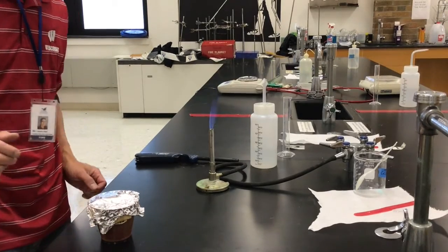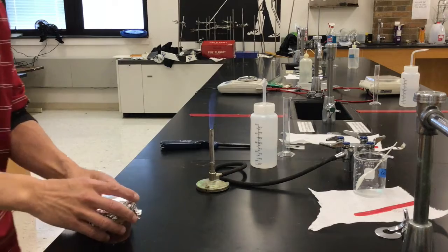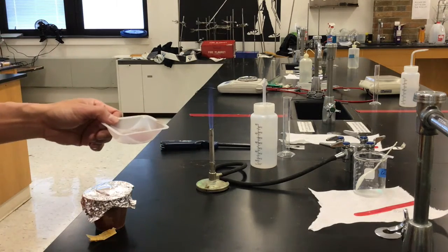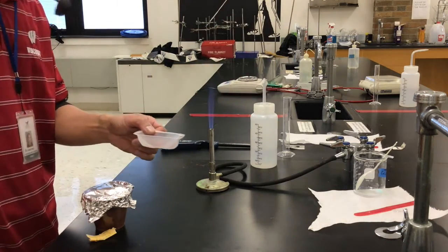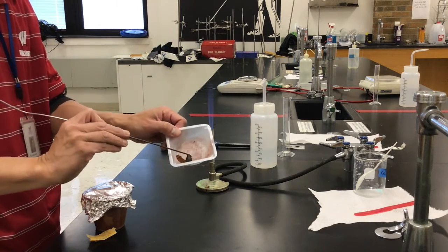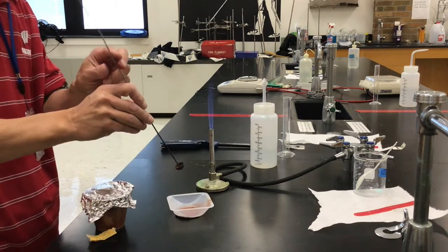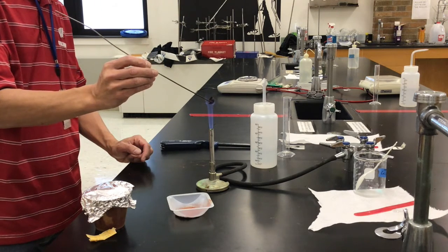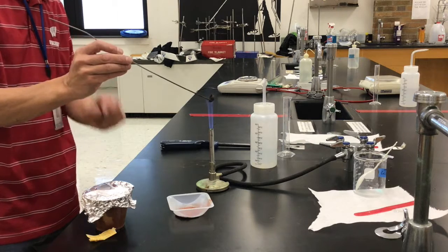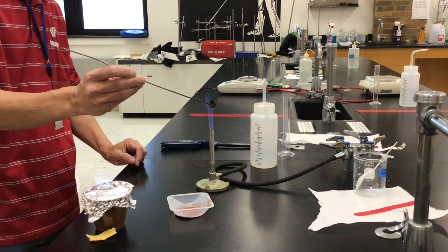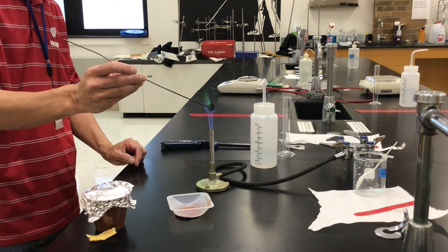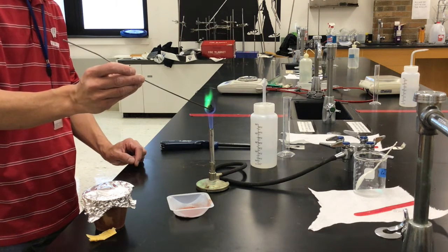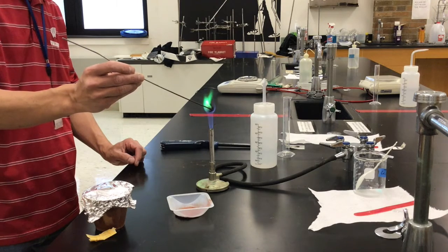Another test we can do is looking at the flame color of the different substances. If I take the solid here, this is my solid from the cup. I put some into a deflagrating spoon. I'm going to put that in there. We're going to look at the flame color. What does that tell us about the substance? Once you see that it is turning that color there, okay?